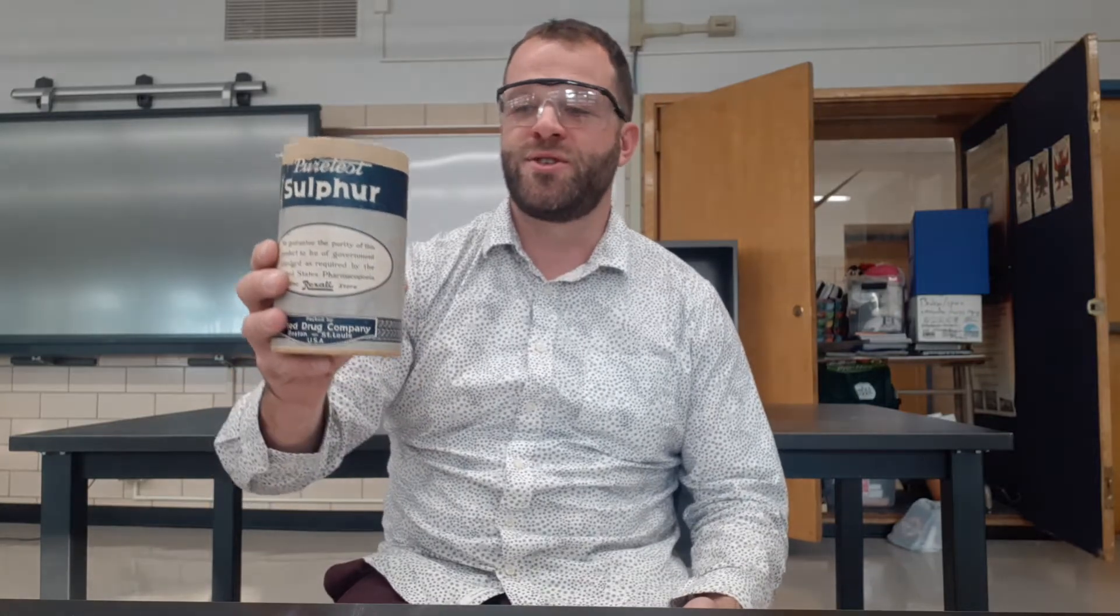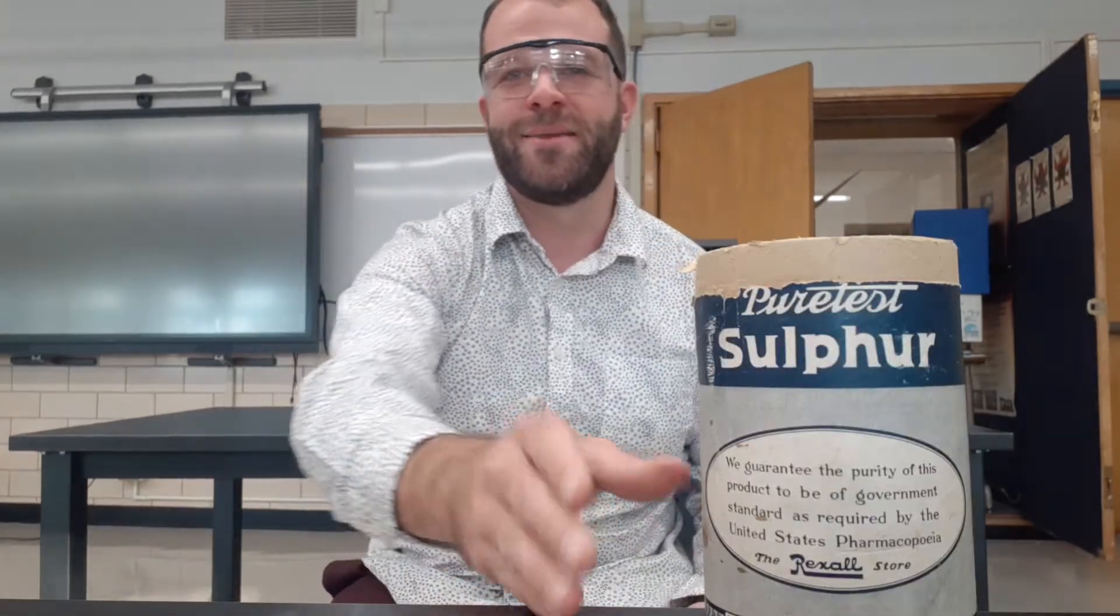And I know what you're thinking, 1948 called they want their sulfur container back. Burn, shots fired. Come on now. And we'll be placing that sulfur onto water.